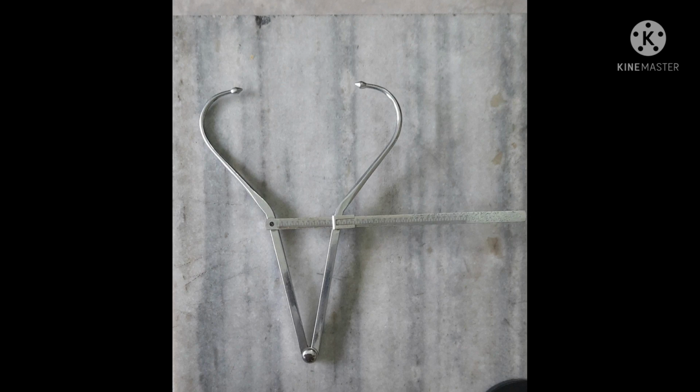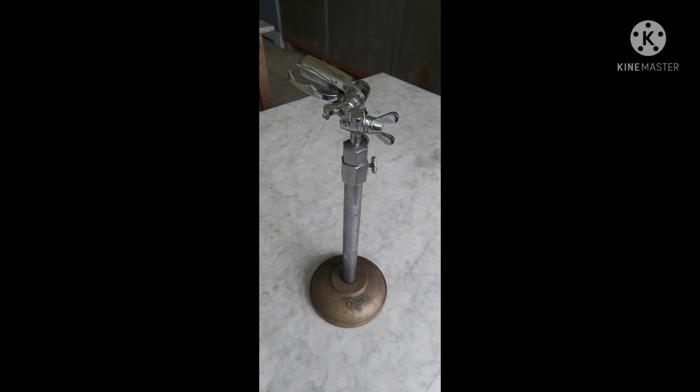The one with rounded edge is used for taking measurement on living subjects, while the caliper with sharp pointed end is used for taking measurement on the skeleton. The spreading calipers are normally used whenever the surface landmarks are situated on curved or uneven surfaces.